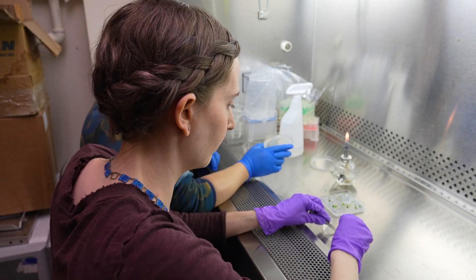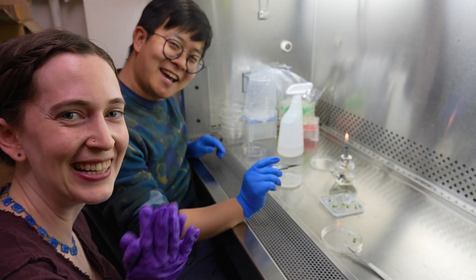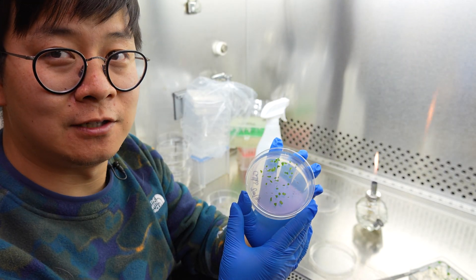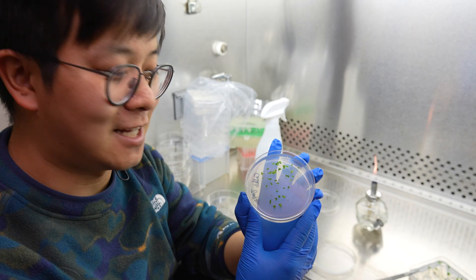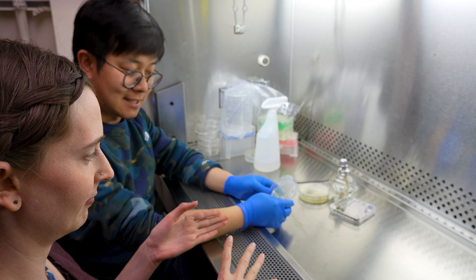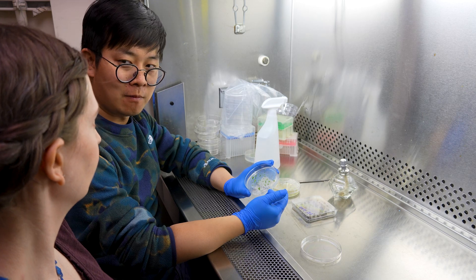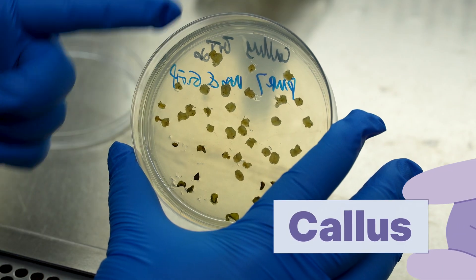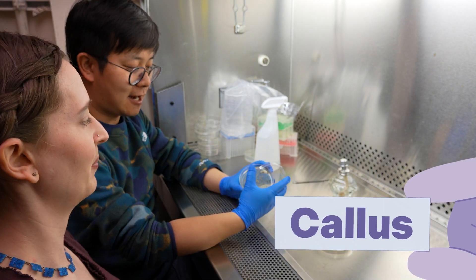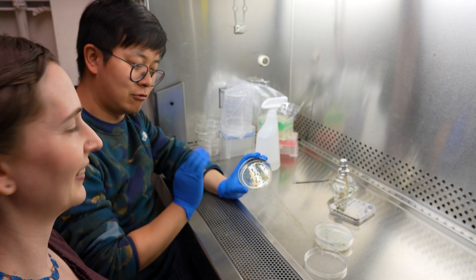Oh my gosh, I'm so excited — the tiniest little chops! All done, chopped up everything. Now the pieces are resting on what we call regeneration media. Now we just need to sit around and wait and be patient to let the plant babies do all the work. And now we want to make a whole plant just from those little chopped up bits. Yes, and it's going to take several stages. The first stage: the hormones in this media are going to help them to form a specific type of tissue called the callus, as I'm showing here — which is from a transformation I did a month ago. Oh my gosh, the callus is blobs! Yes, they are a blob of cells that have the capacity to form a plant, including the shoots and the roots again.